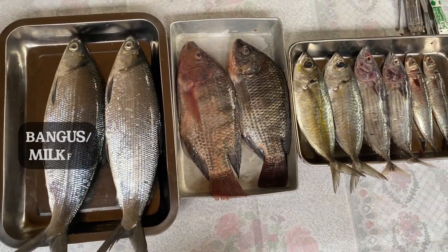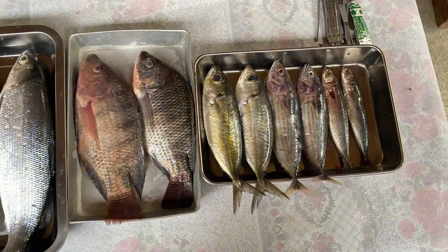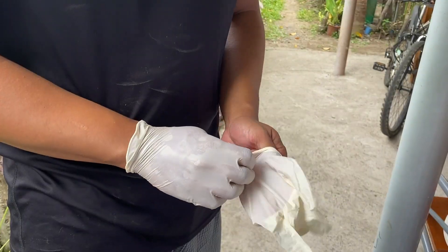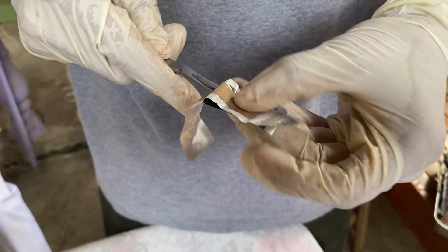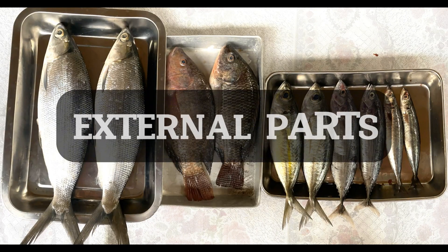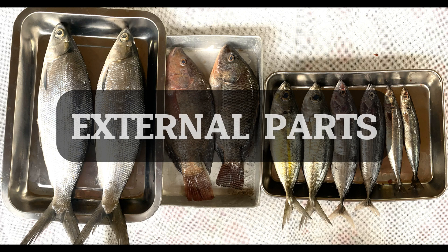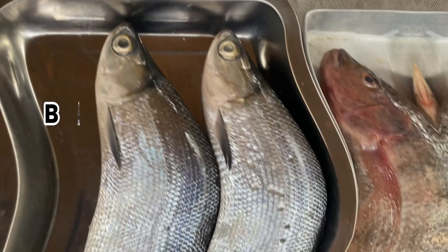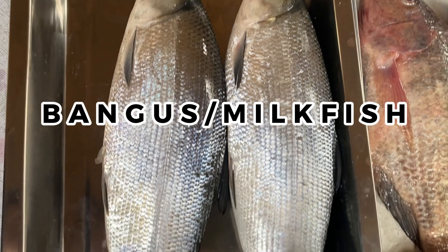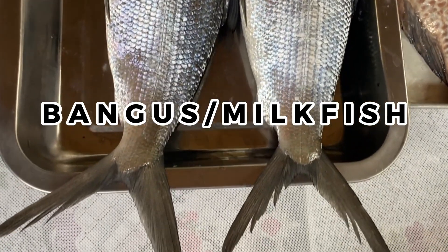Hello everyone. In this video, we are going to explore the different external and internal parts of the fish. Let's get our gloves and scalpels and get started. First, let's explore the external parts of the fish. We are going to use the bangus as a model to show and define the external parts.